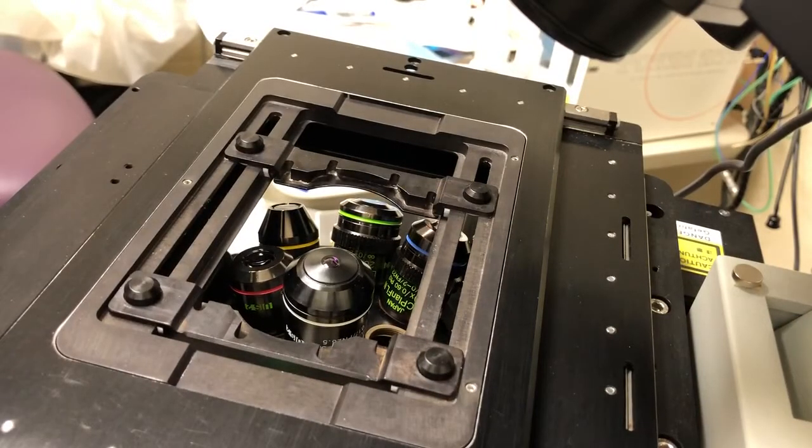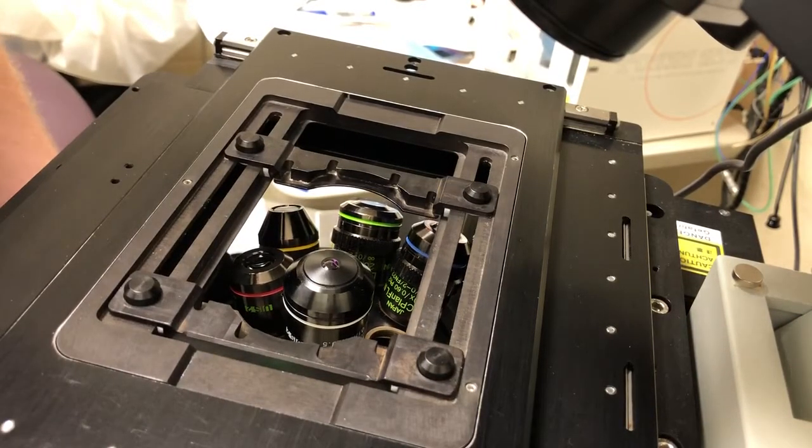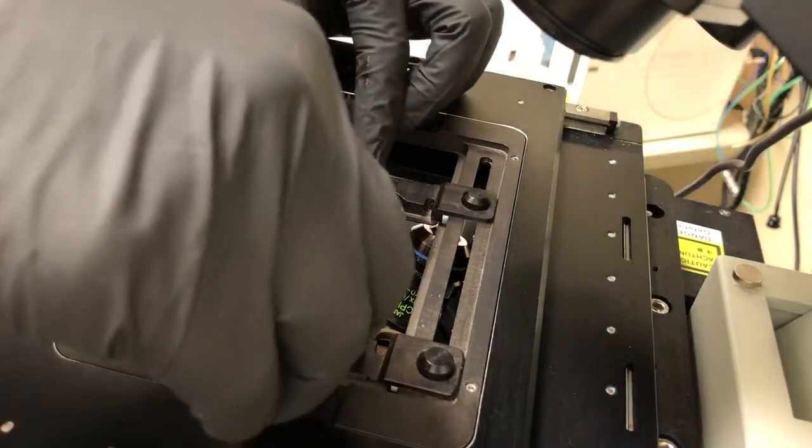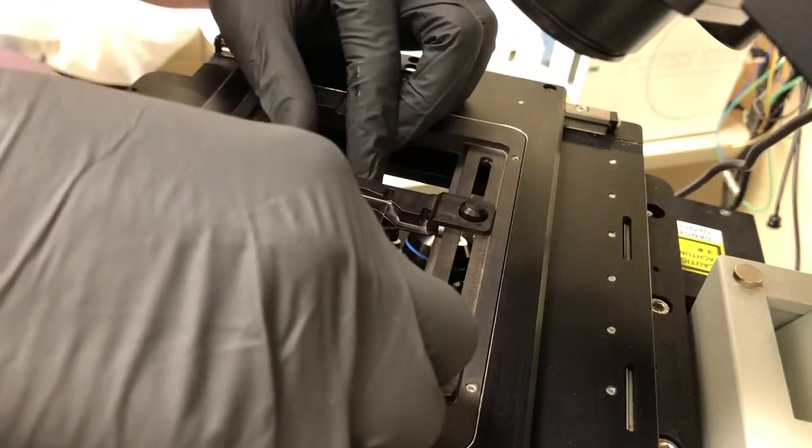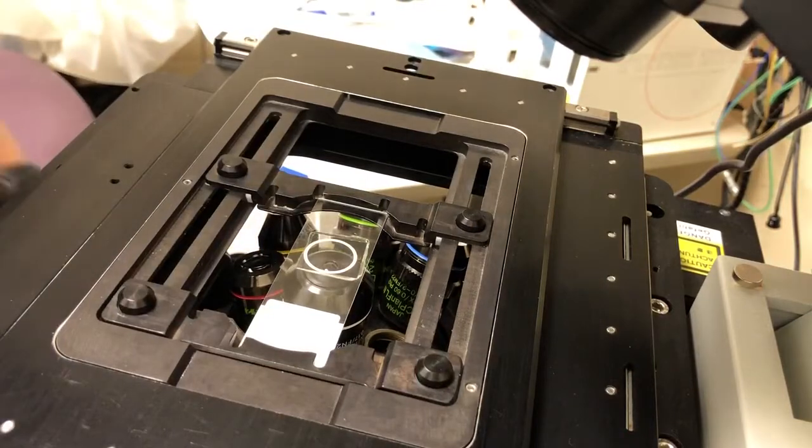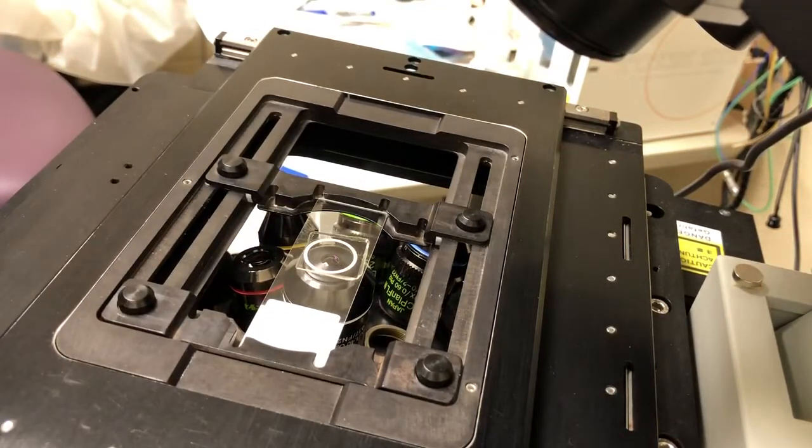Now we're ready to put on the sample. When we put on the sample, we want to hit Escape. Put it on, always carefully. Then hit Escape again, and the objective should go up.